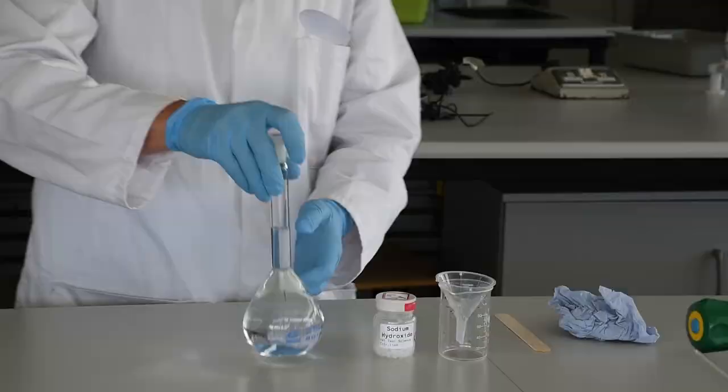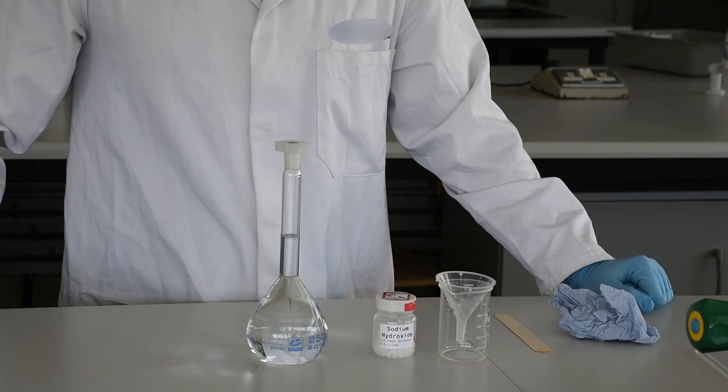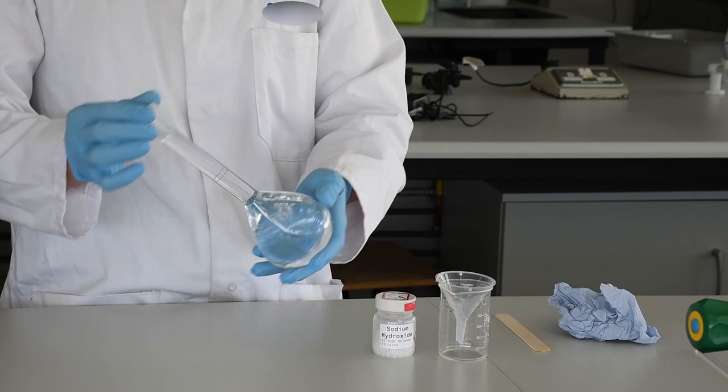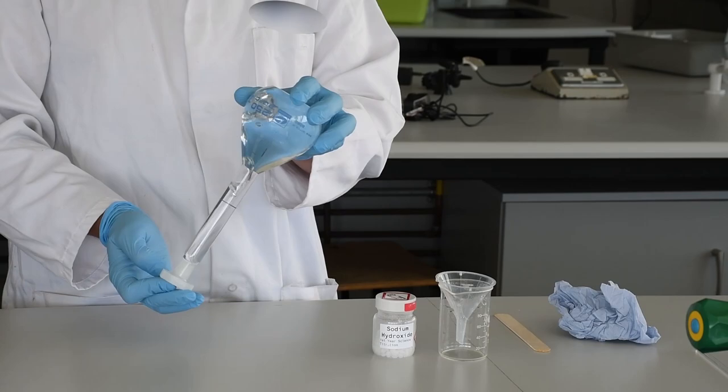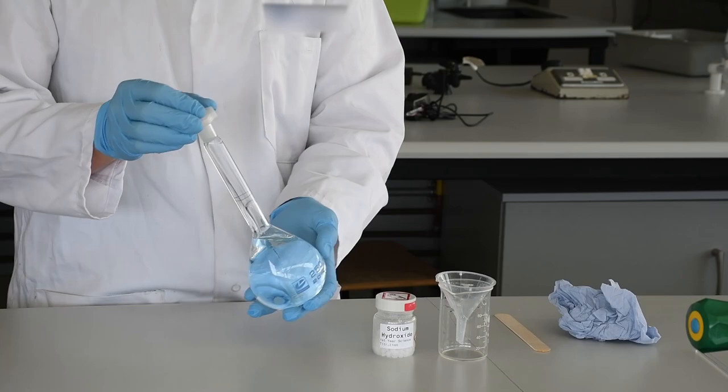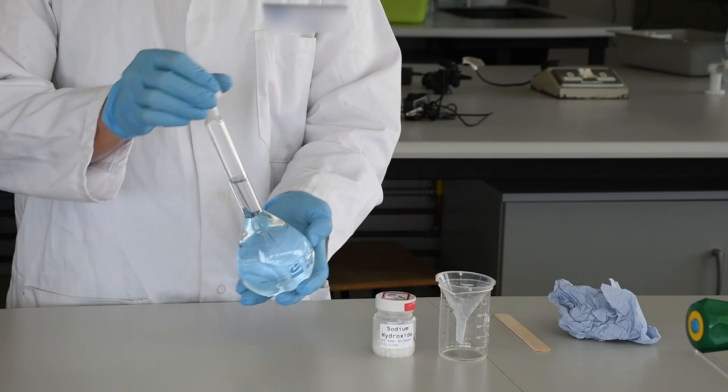At that stage, we put in the stopper, give it a little twist, and while holding the stopper in place, turn the flask upside down about 20 times. There's no point in shaking the flask because it won't mix the material in the neck. Just keep turning it upside down and back. This is another reason why there's no point putting things that aren't dissolved into the volumetric flask.